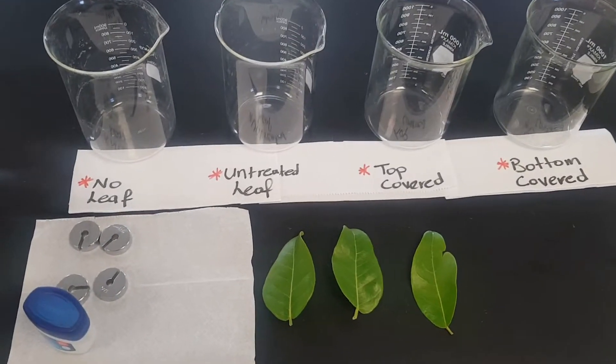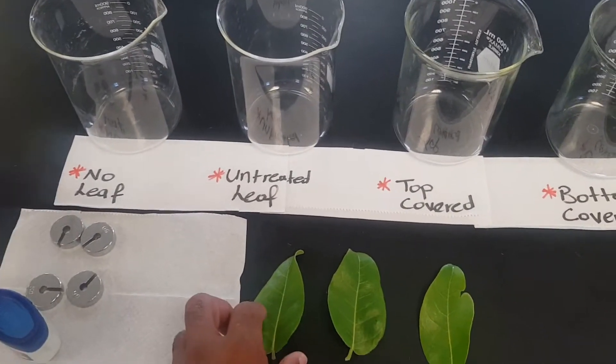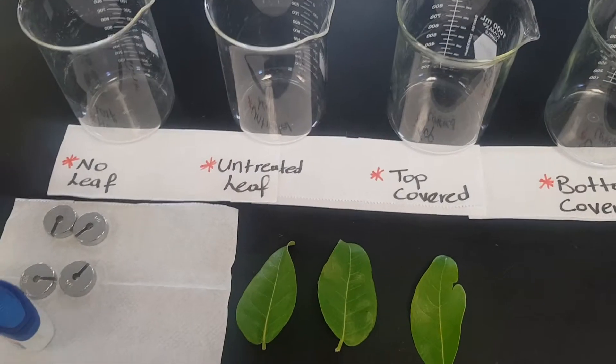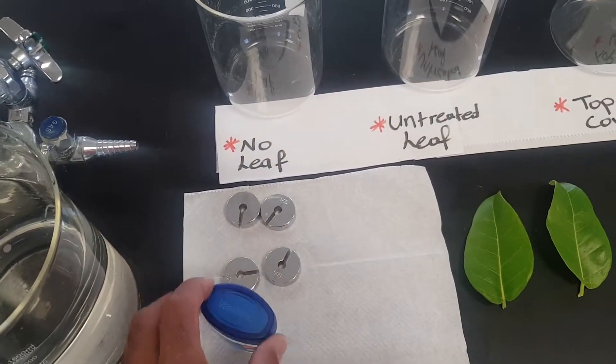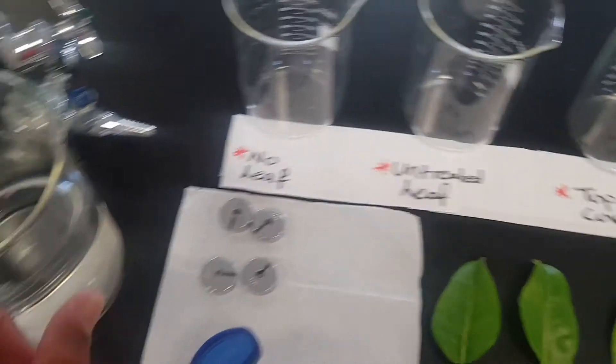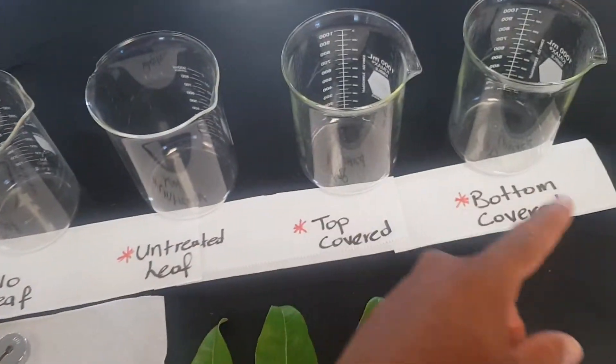Today we're going to use leaves of the same size or relatively the same size. We're going to use some weights, Vaseline, water, and large beakers.